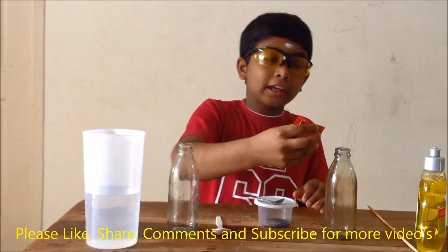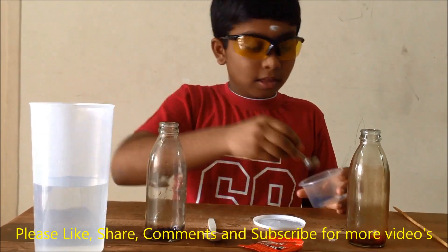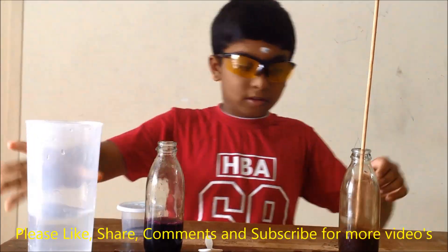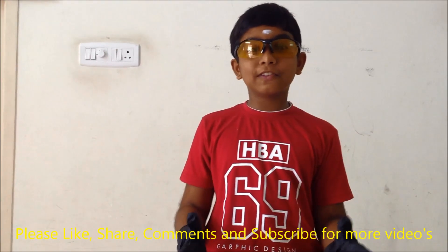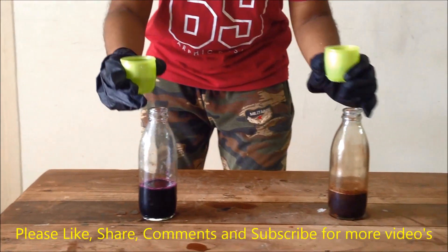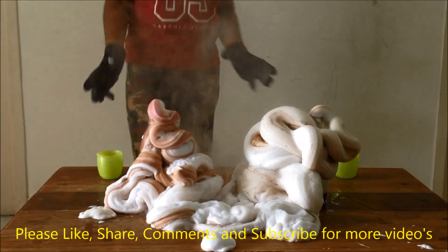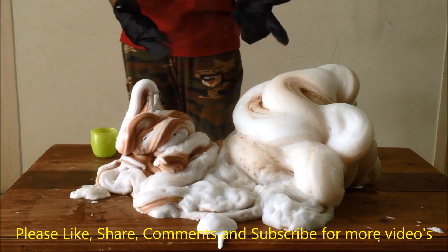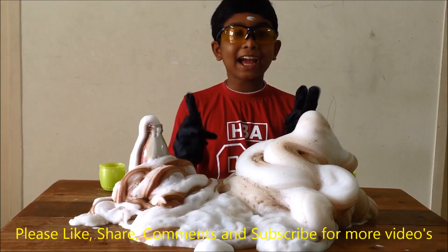Now first we will add the food coloring in this bottle. Friends, we are going to add the hydrogen peroxide into these two bottles. See how amazing it is — the elephant toothpaste is done! It will be very hot, so you should not touch it. The chemical reaction is done.